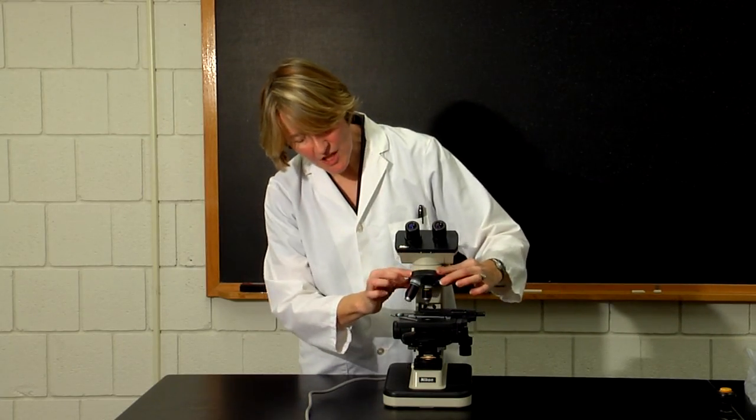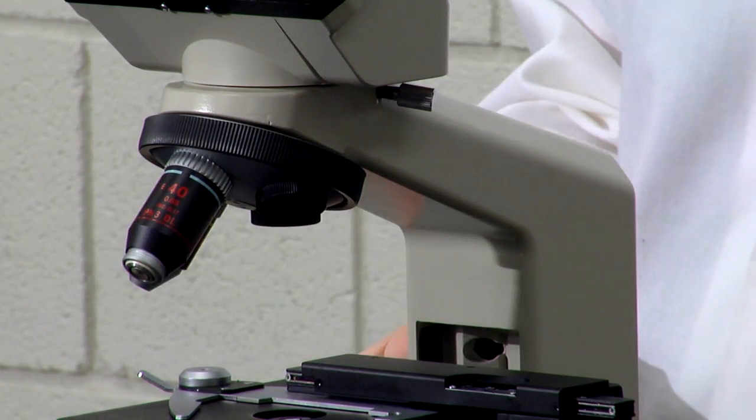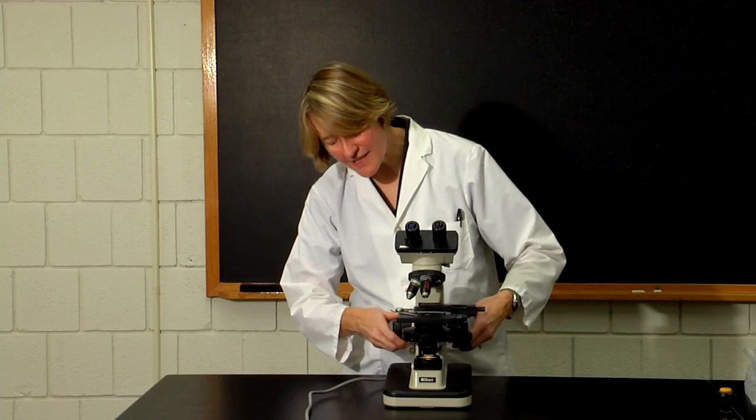Rotate the nose piece so that no lenses are over the stage, and then raise the stage to its highest position.